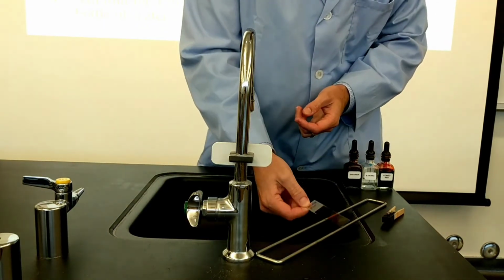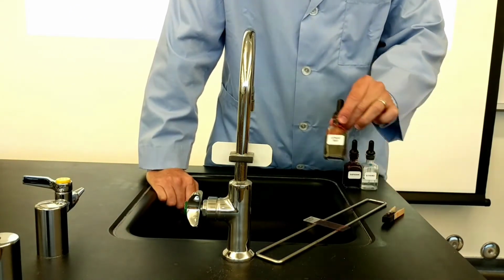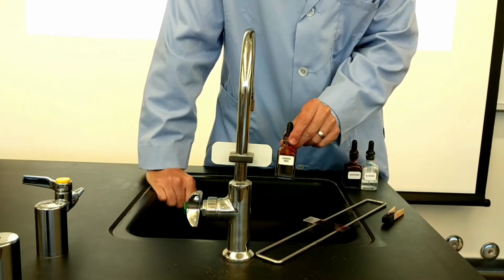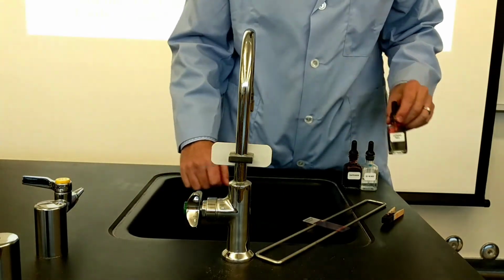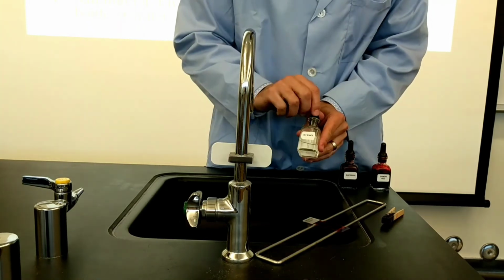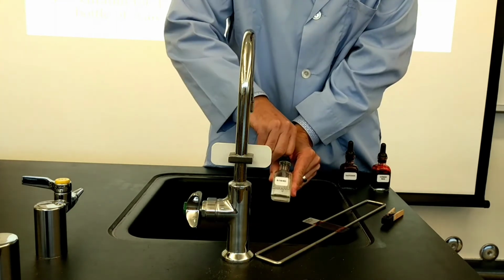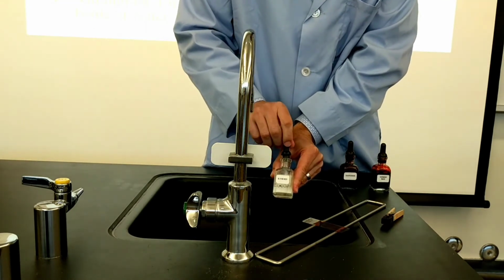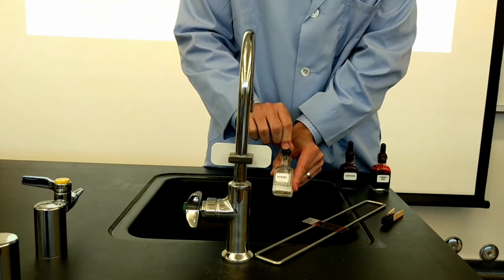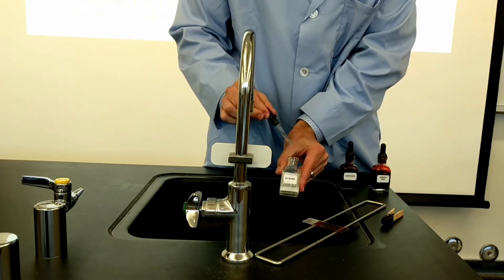So I've got a fully air-dried negative stain, and if you recall, I used Congo red, which is what you would use for the first step of this capsule stain. Now that it's fully dry on the slide, the next step, after air drying without the use of heat, is to use 0.1 normal HCl. Basically, this is a hydrochloric acid solution that's strong enough to kill the bacteria and also to fix them to the slide so that they don't just rehydrate and wash off.